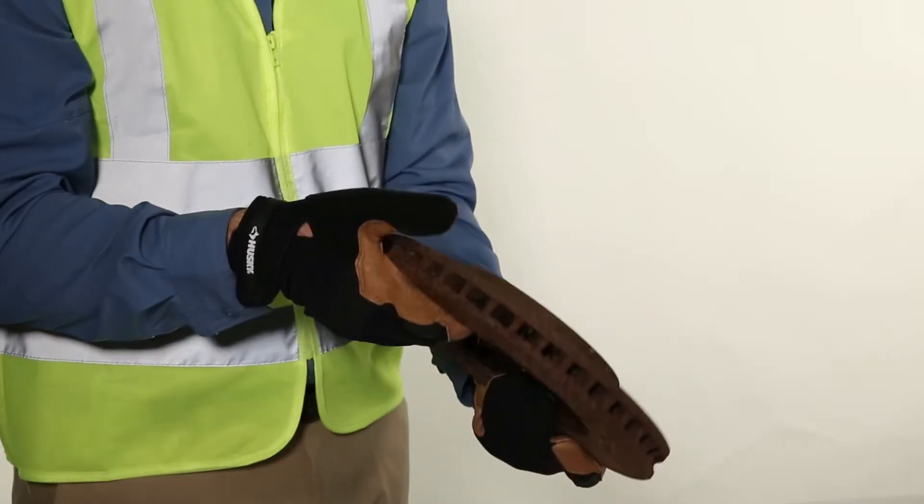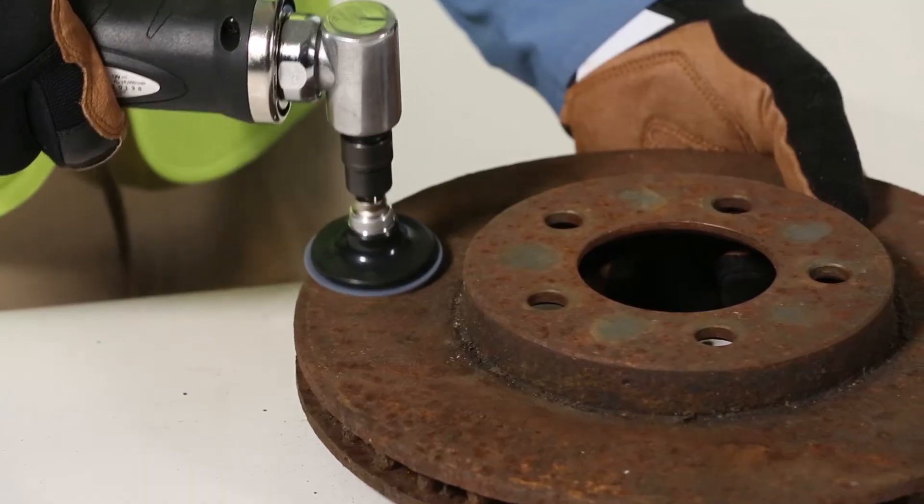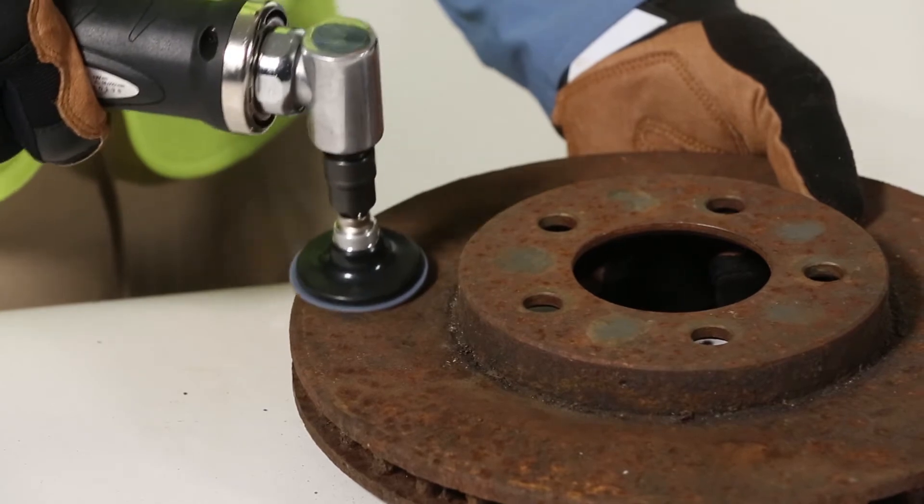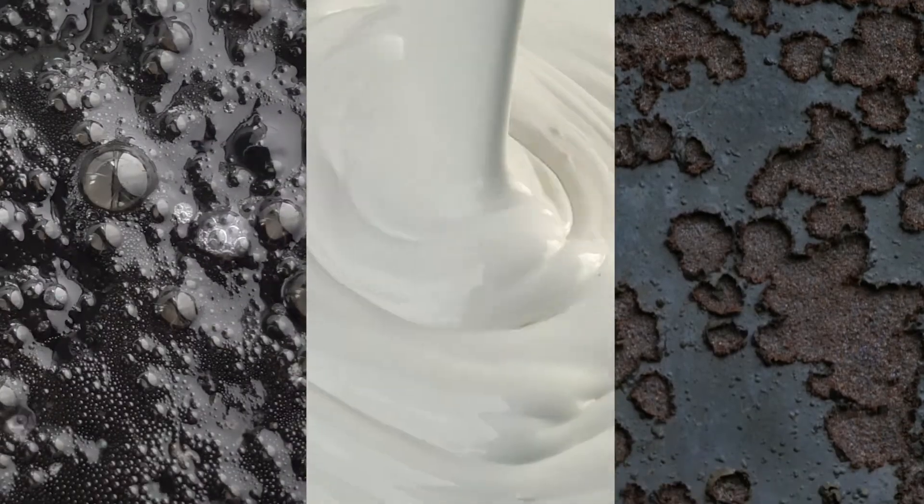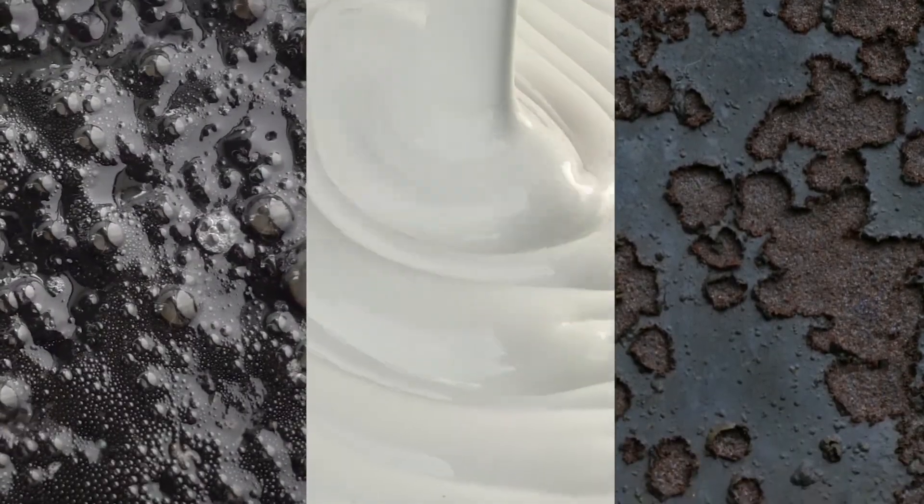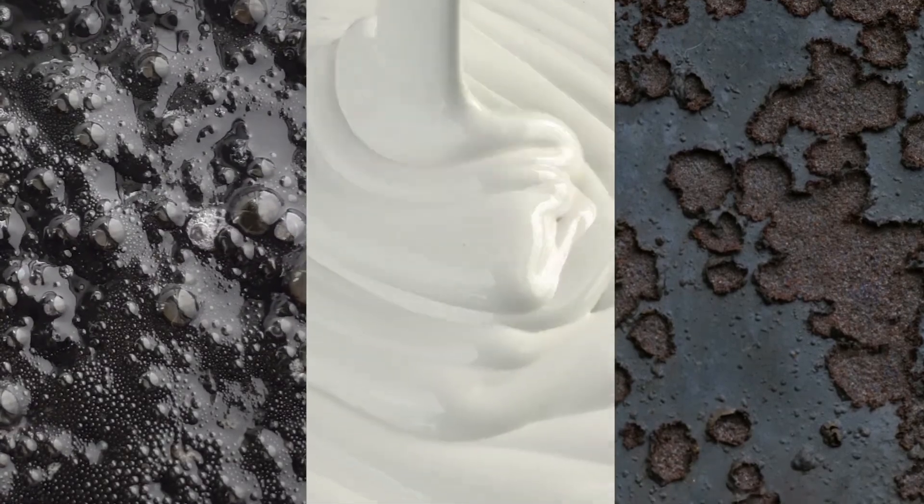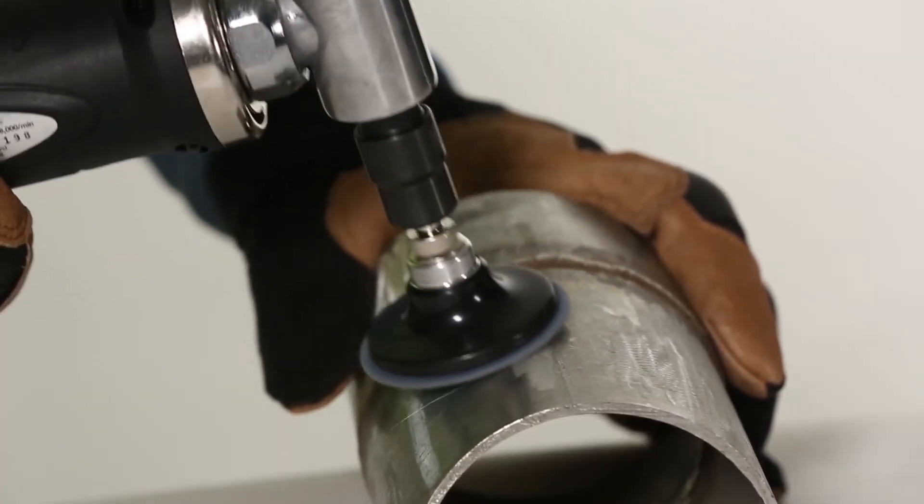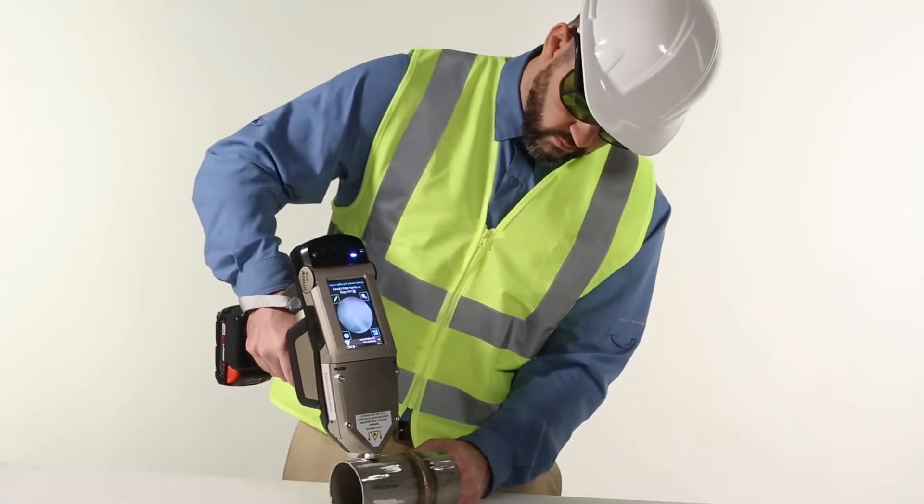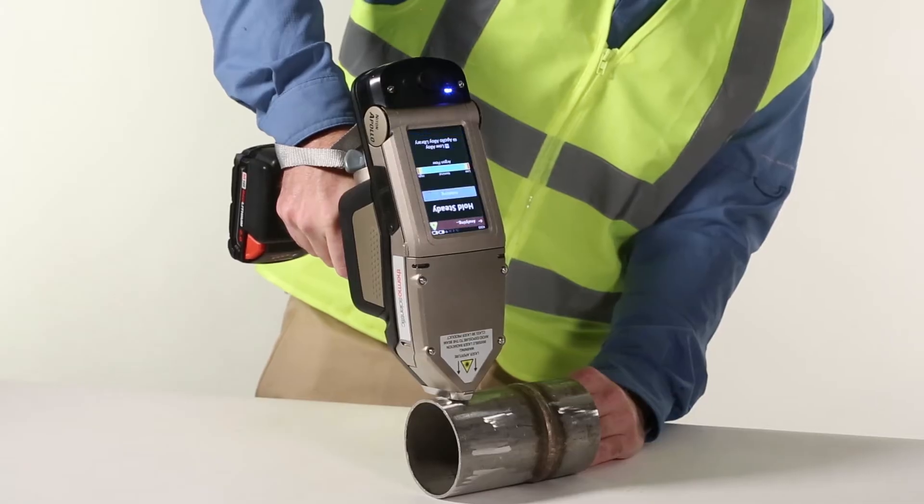Unlike with handheld XRF, proper sample preparation is essential to achieving accurate results. Trace amounts of contaminants such as grease, paint, or scale may yield unreliable outcomes. Follow this tutorial to achieve the best analytical performance and minimize invalid results.